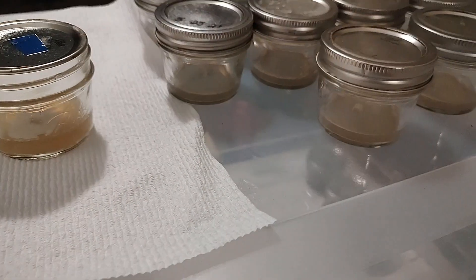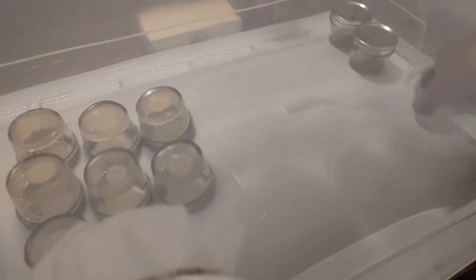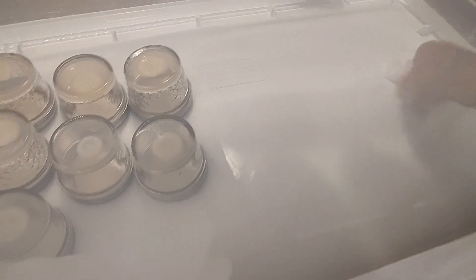I'm finished with these transfers here and I made a video about it. I'm going to pull all this out and then clean this side from the transfers. Usually I wear gloves but I'm videoing and I didn't want to drop the phone, so I'm going to clean it again.